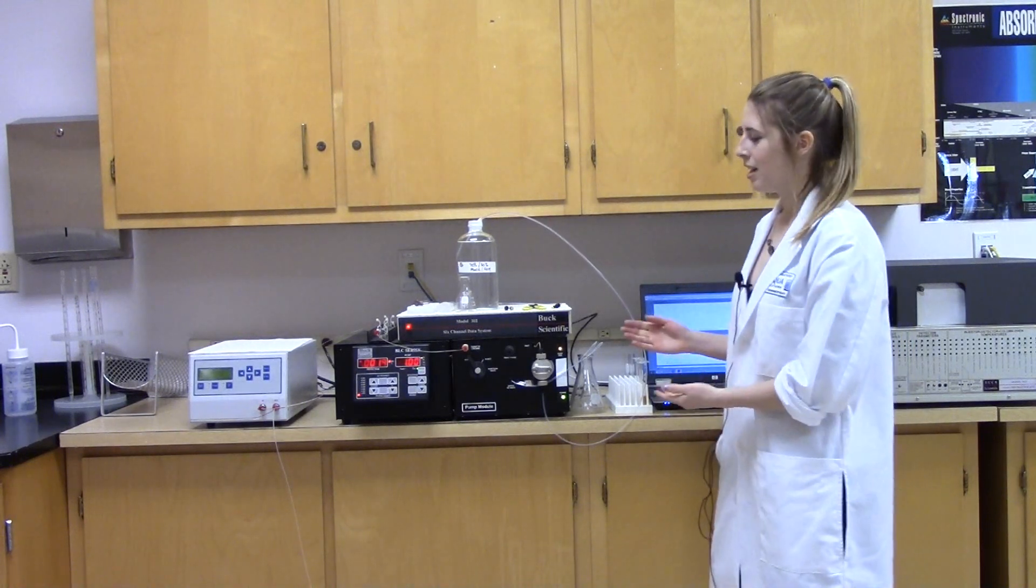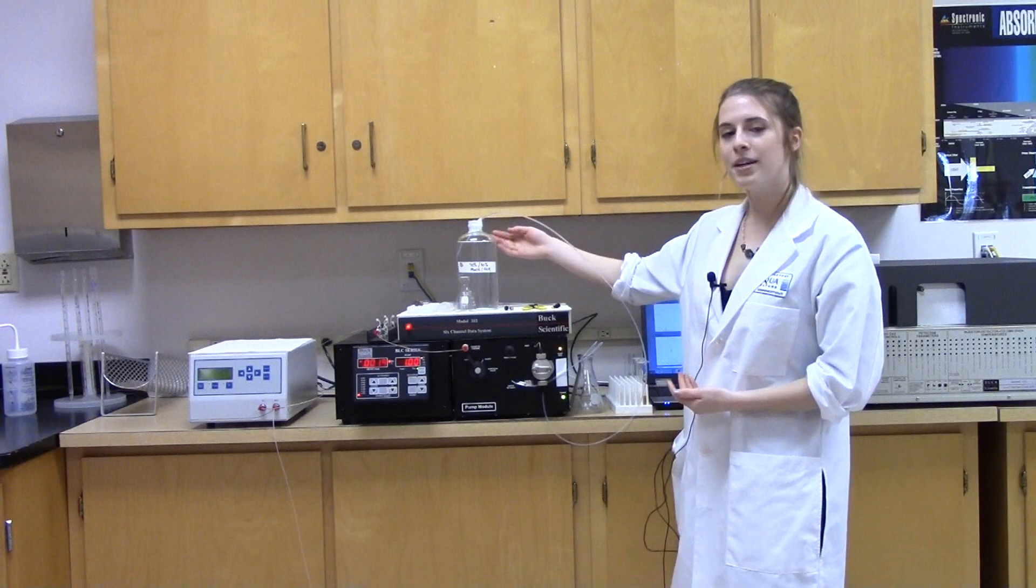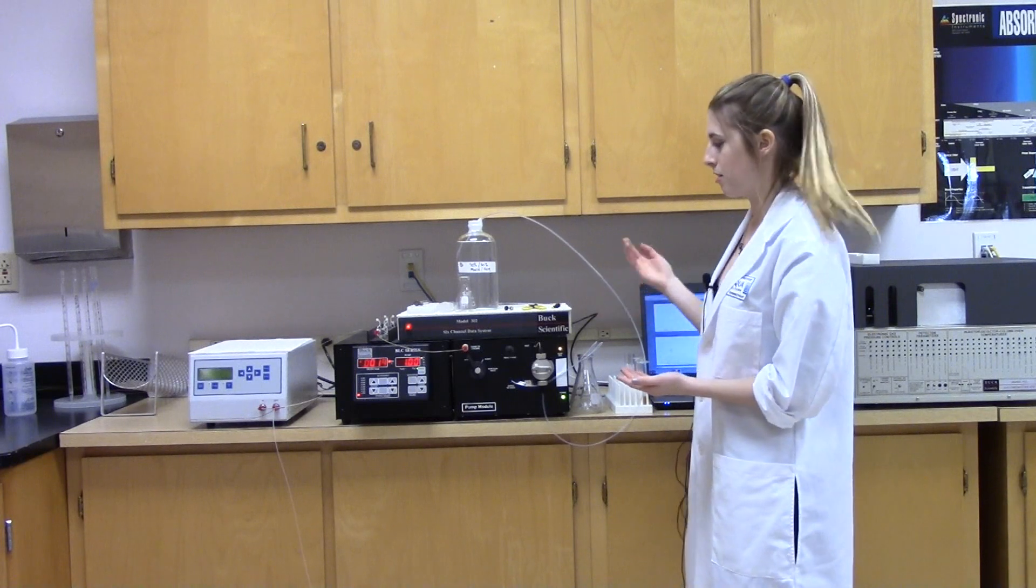After preparing the samples, we can come over to the HPLC. The HPLC is actually a collection of many different devices. Up here, we have the mobile phase. This is what's being pumped through the entire system and what will carry whatever we inject through the instrument.